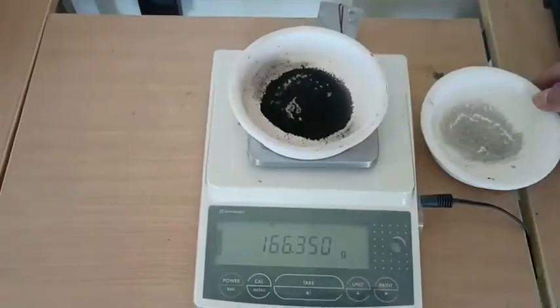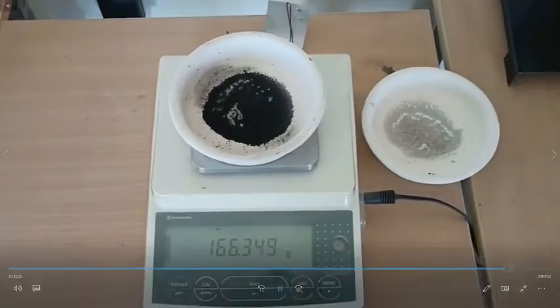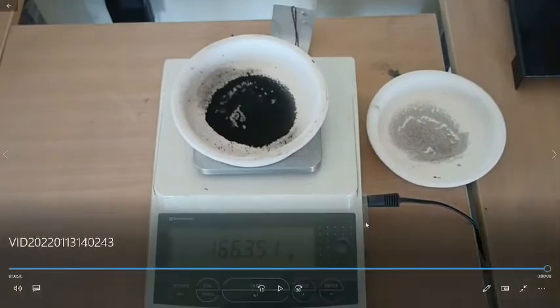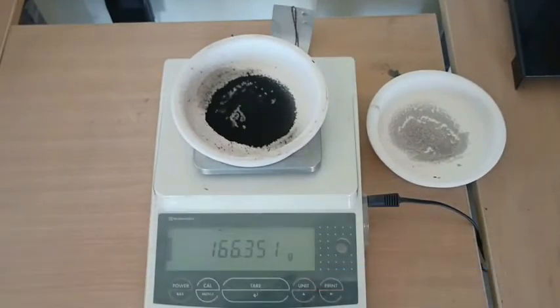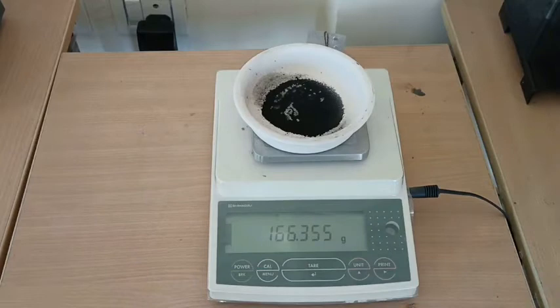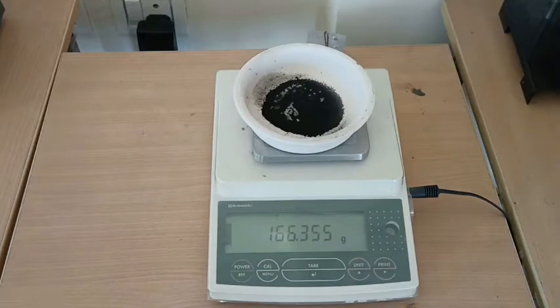If we don't use a lid, the sample gets oxidized in the presence of air. Here you can see the ash content which is carried out without a lid — it is white — and here the black one is from removal of volatile material using a lid. That is the difference between using a lid and not using a lid. Here is the final weight of the sample with crucible.